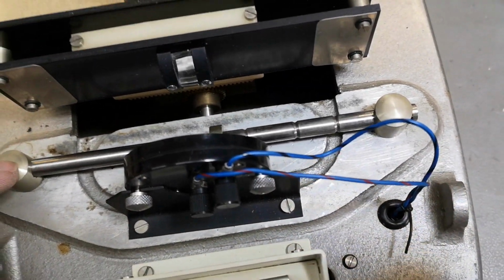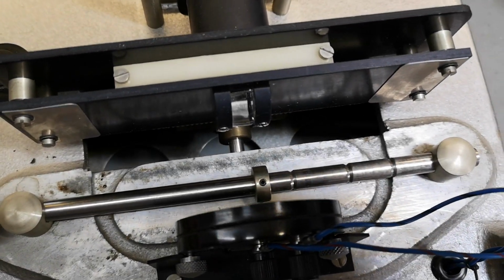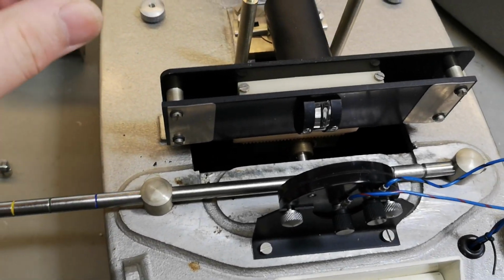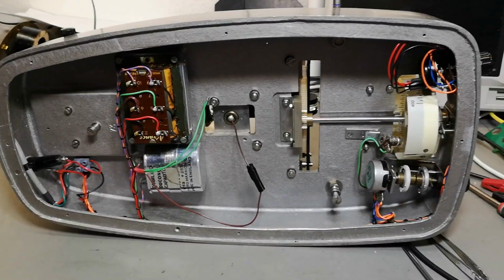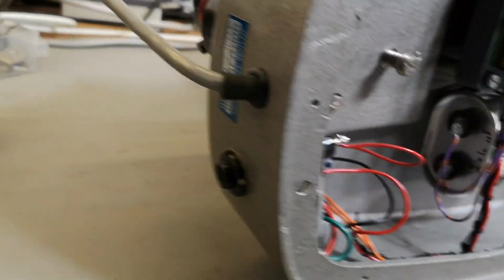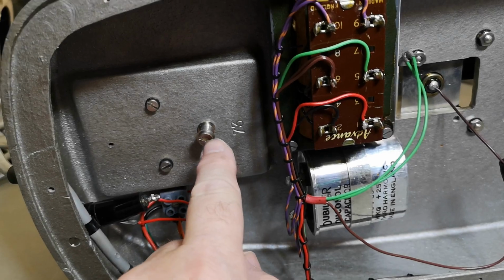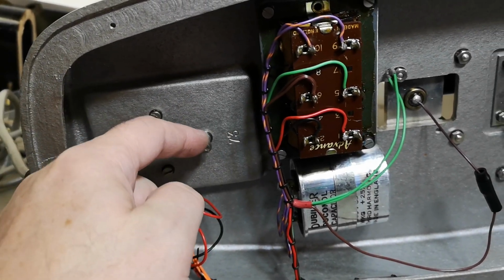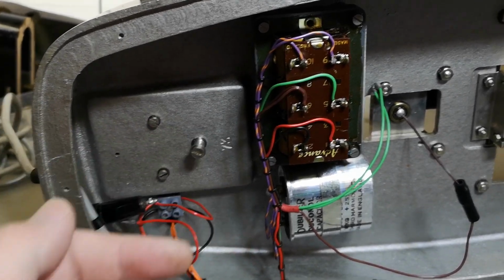So I need to figure out if there's a screw on the bottom that creates the pressure to this stick, because I want this to be able to move. There's a reason why this one was pulled off. Okay, let's look inside the base. So now we are in the bottom parts of this fantastic unit. Oh yeah, we got even a nice little label here on the back. And the mains fuse. This screw is probably for angle adjustments of the light reflection unit, so we can make this line appear exactly where it's supposed to be on the readout screen.